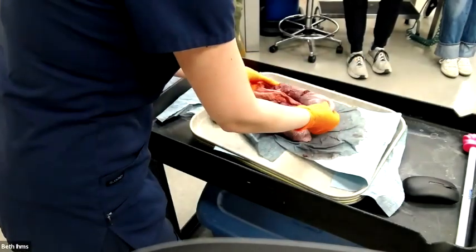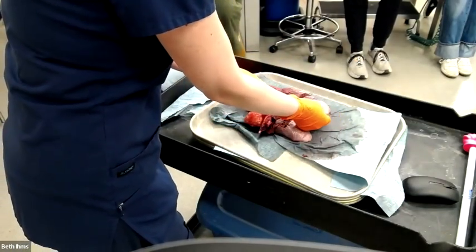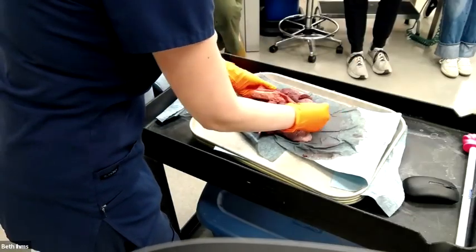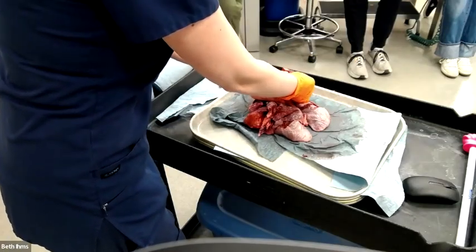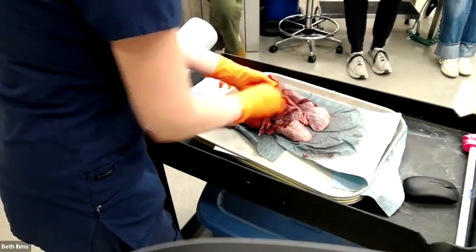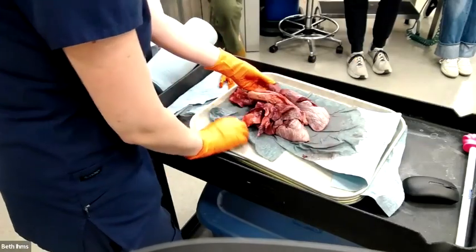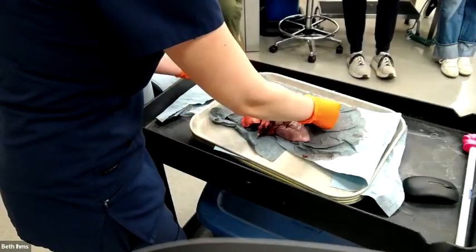All right, so pretty significant texture difference between the caudal lung and the cranial lung, right? Could everybody appreciate that? This is soft and fluffy and a little bit aerated. This feels like liver. This is solid and dense. There is no air in here. So I agree, this is the abnormal part of the lung. All this dark red, it's abnormally firm and there's no air. Back here, we're still soft and fluffy.